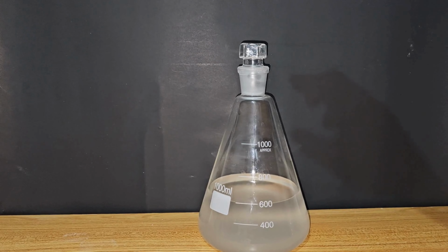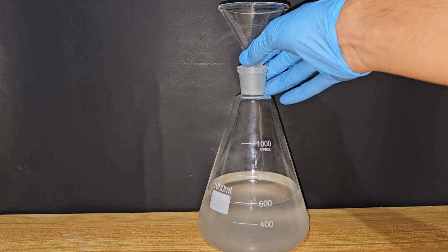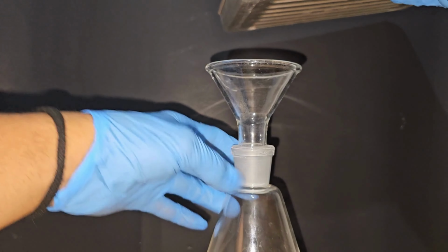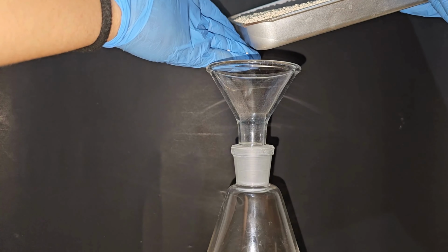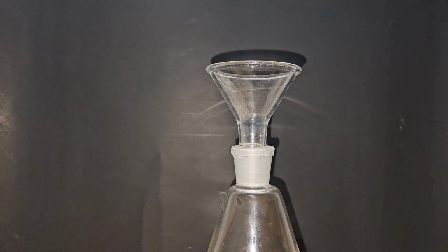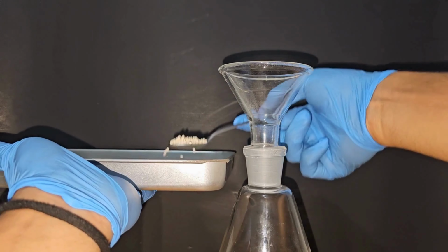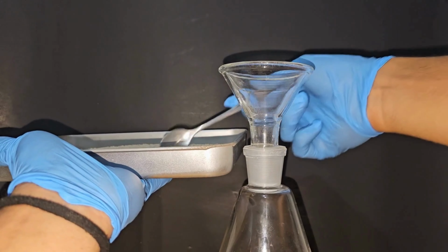To start the experiments, I took approximately 600 ml of some forgotten 96% ethanol from a previous run. Then I started the addition of 3A molecular sieves, which can be purchased in a lot of different places. They are very messy and very difficult to add, actually, so I decided to add them with a spoon. Just to be sure, I previously dried the molecular sieves at 250 Celsius for 2 hours.